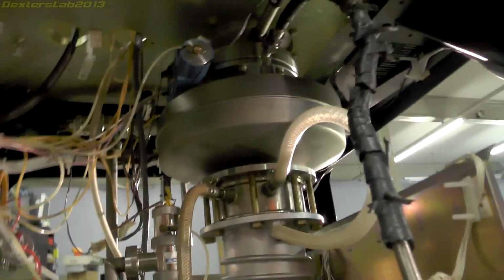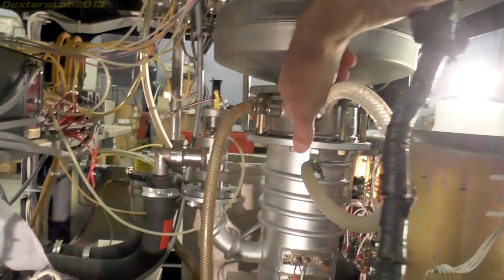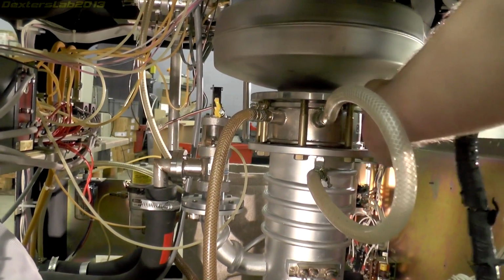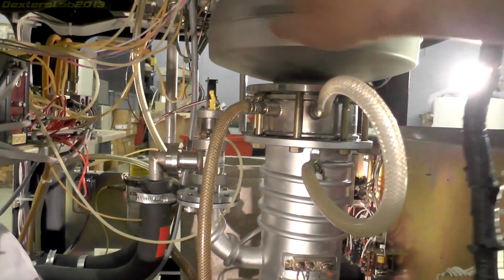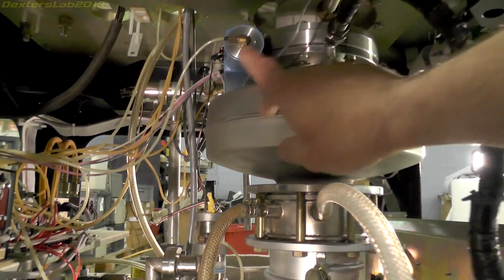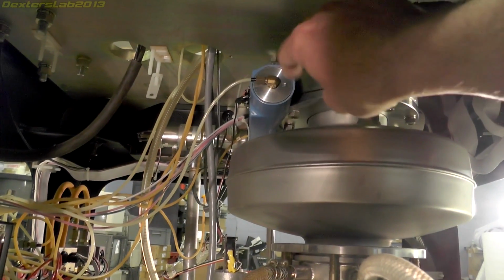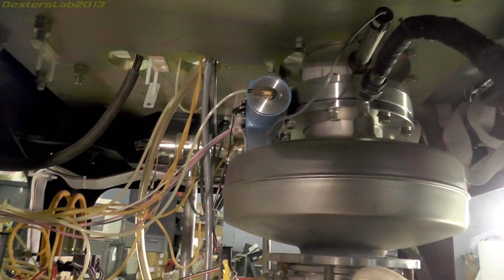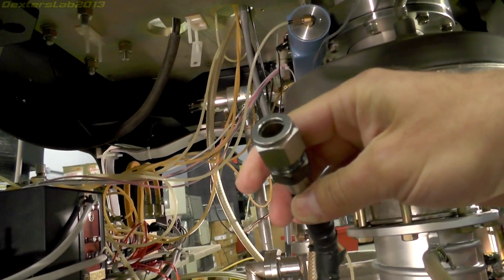So underneath here, we have the main vacuum pump. This is a large diffusion pump with a water cooling jacket on it. This part here is a baffle, and that prevents any of the vaporized oil from the diffusion pump passing up into the sample chamber. I'm not quite sure what this big bit is here. I think it's just more part of this, just to stop oil getting up into the sample chamber. There's a number of bits on here. It's a bit hard to see exactly what they are until all this comes out, or at least get some more of this off. There's random pipes all over this place, and I'm not entirely sure what they're for. That obviously hasn't been tightened up in a long time.